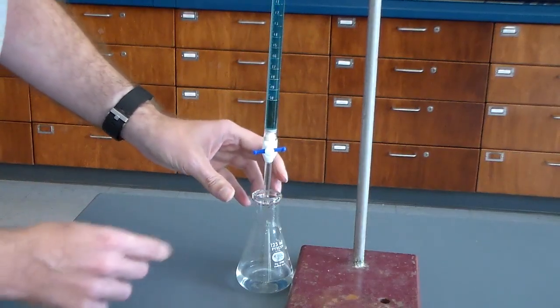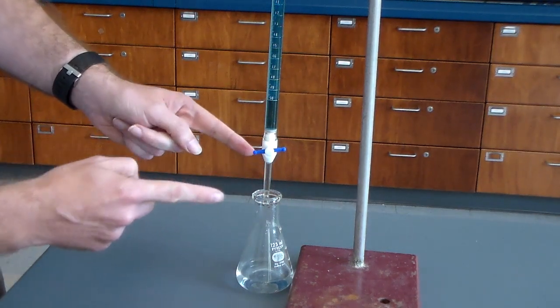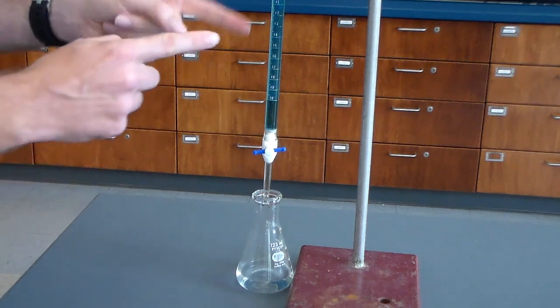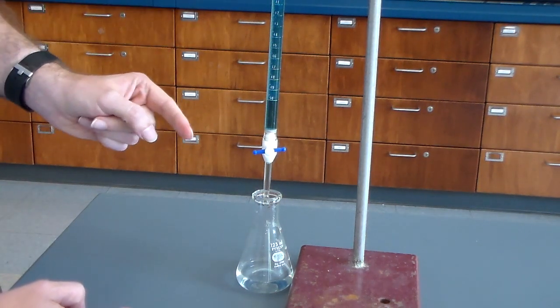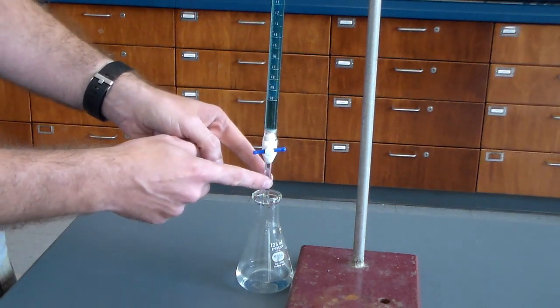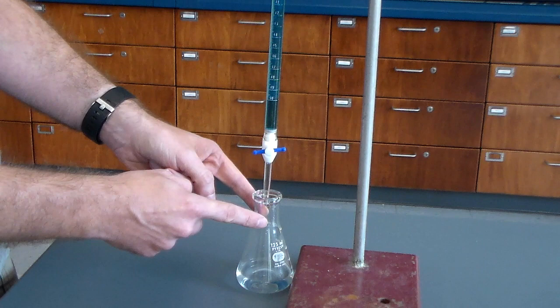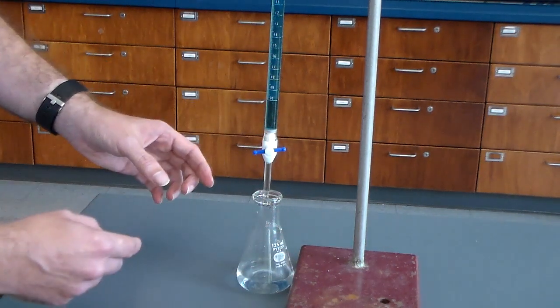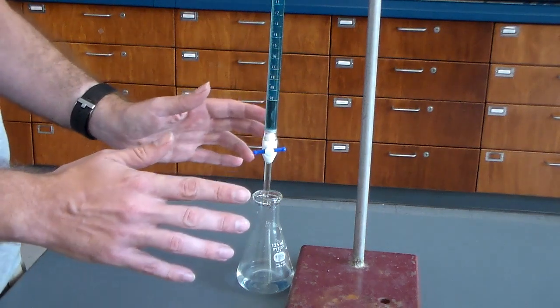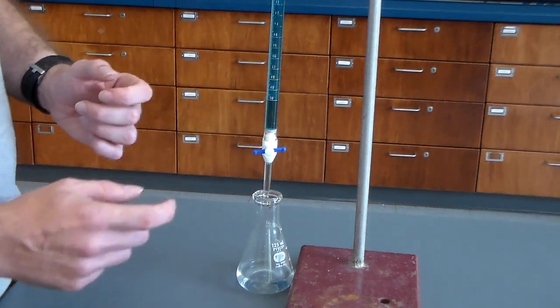Now when everything is set up, you want to make sure, first of all, that there is no air bubble in there, so we're good there. Also make sure that you have read where your starting point is to 0.01 milliliters. And then we want our end of our Buret to be inside of our flask, because we want to make sure that it doesn't accidentally drip on the outside. Now what I'm going to do here is relevant for people who are right-handed. If you happen to be left-handed, do the opposite.